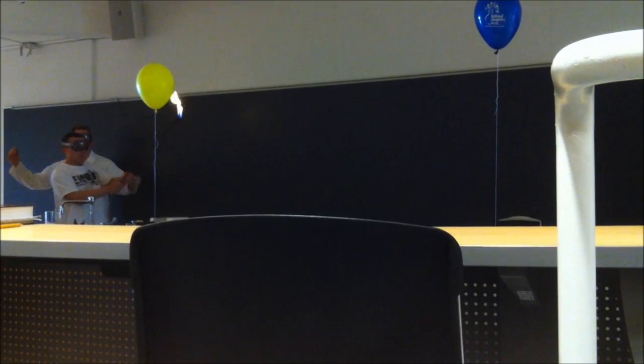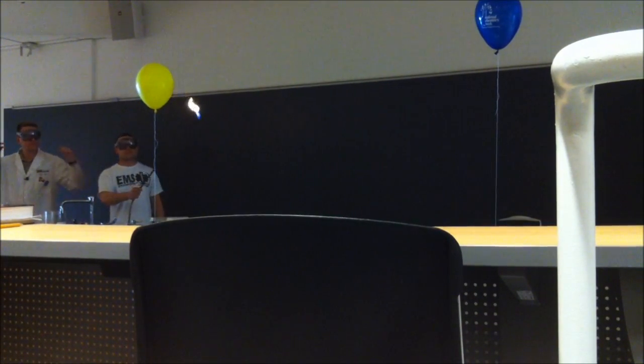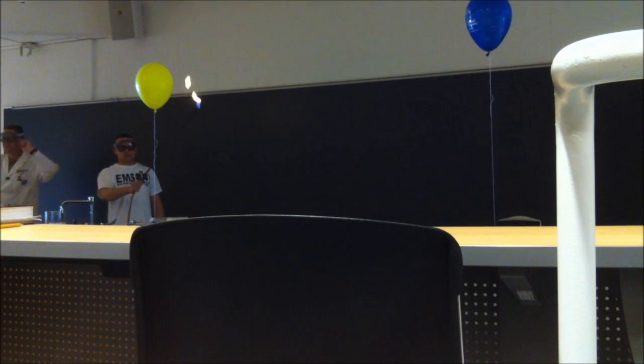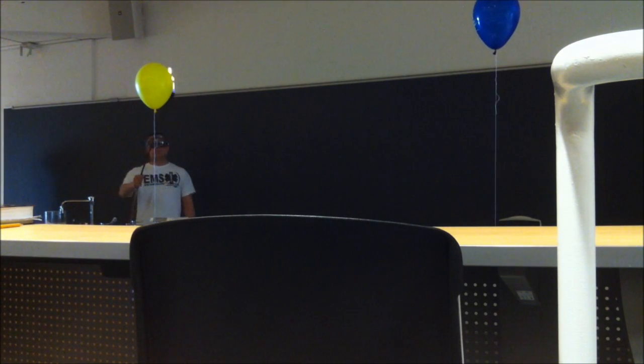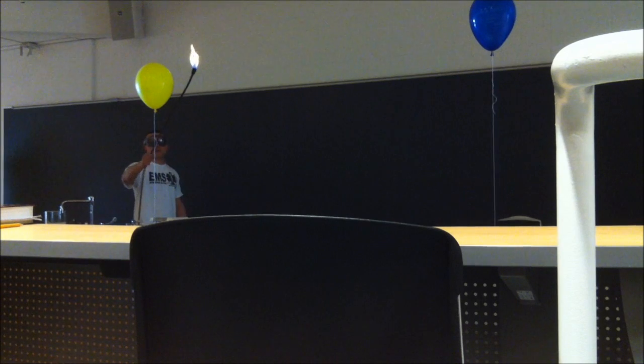Okay, everybody put their fingers in their ears. Fingers in their ears, all right. Okay, Taylor, go ahead and do the non-stoichiometric way.